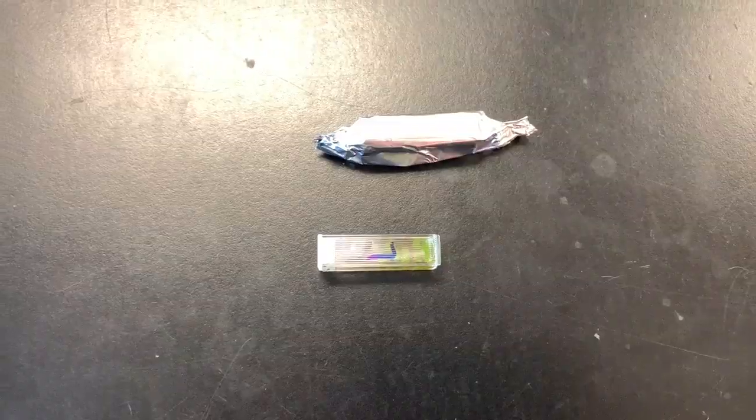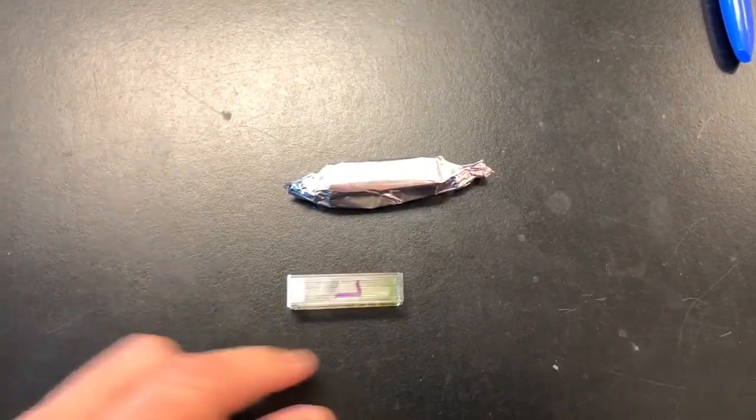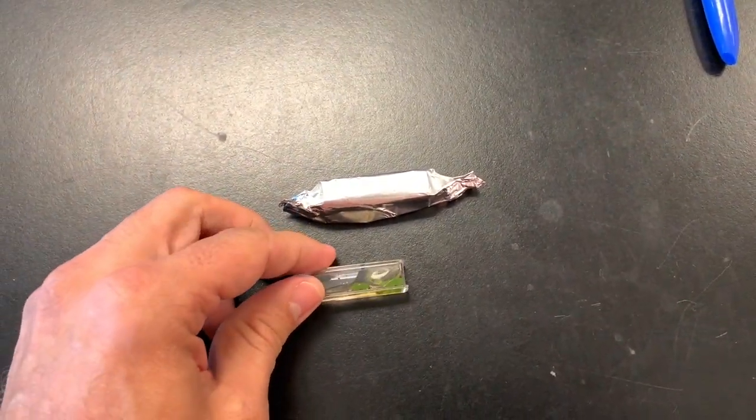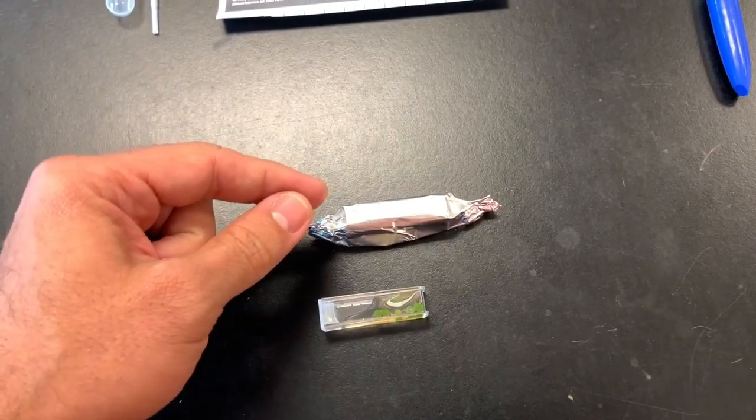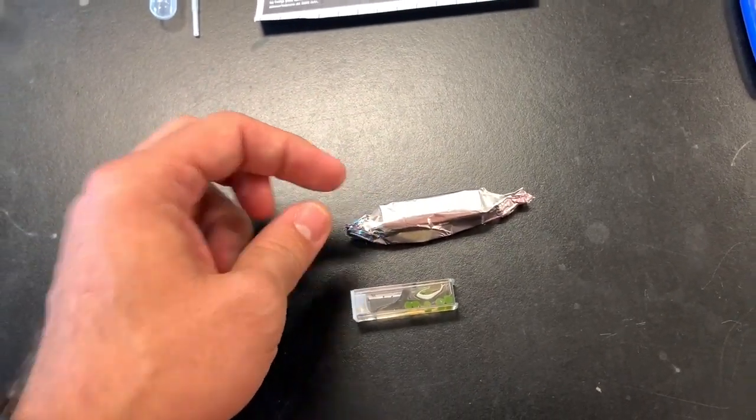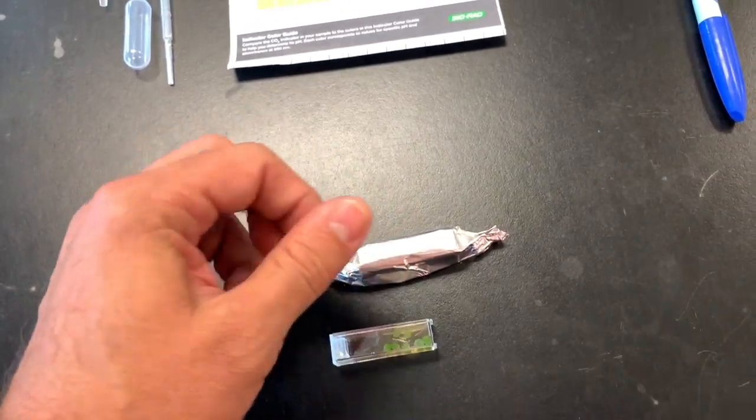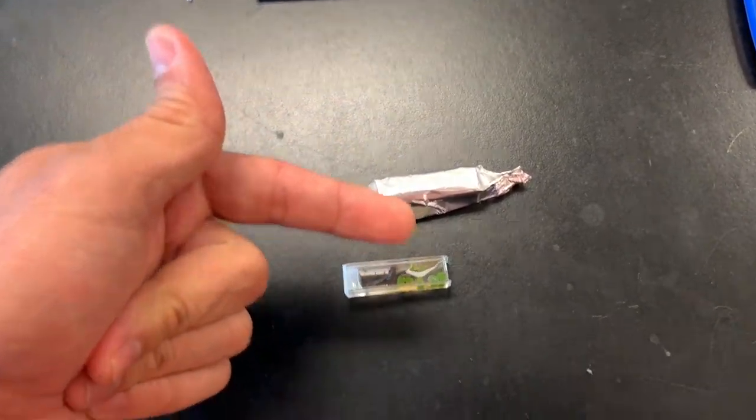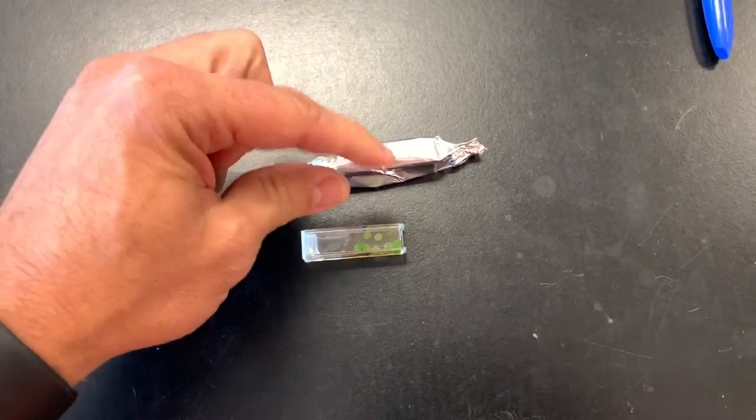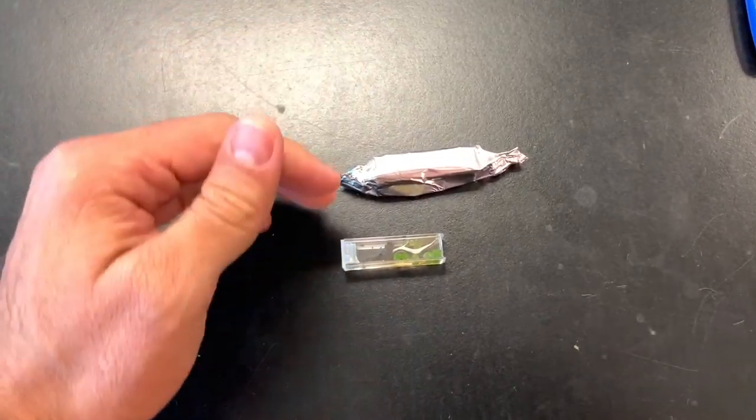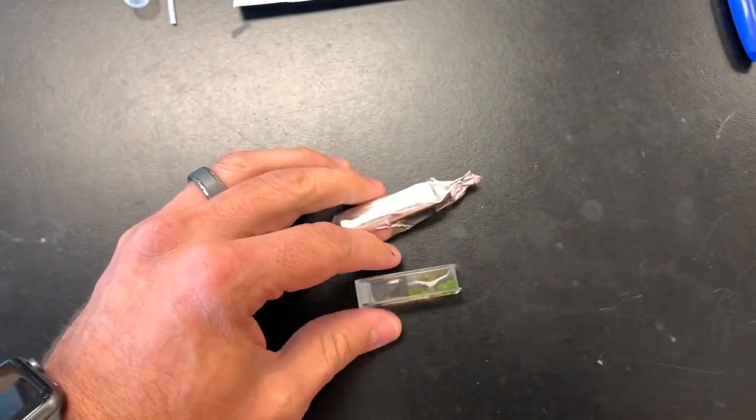So here's my light one, which you're going to leave out. Here's my dark one, I just rolled it and then just sort of pinched the edges. You don't want to scrunch it up too much because you have to, every five minutes, you're going to be checking the change in the pH. You want to be able to get this out easily and then put it right back in. So once you do that, you're going to go and put both of your algae beads underneath the light here.